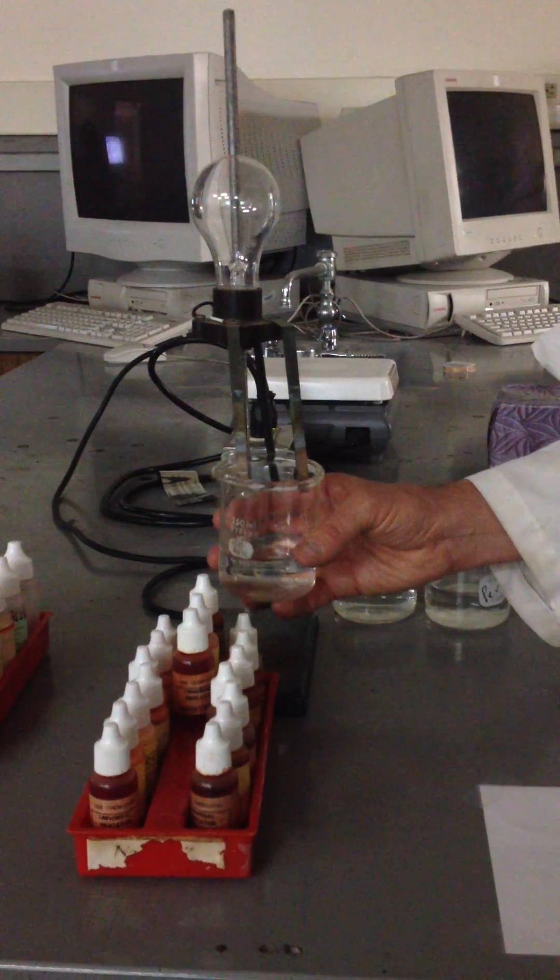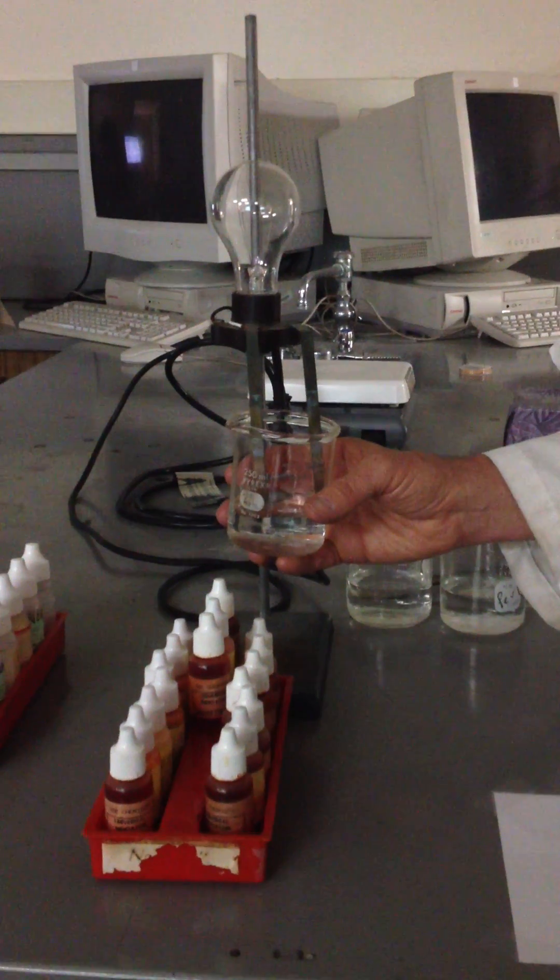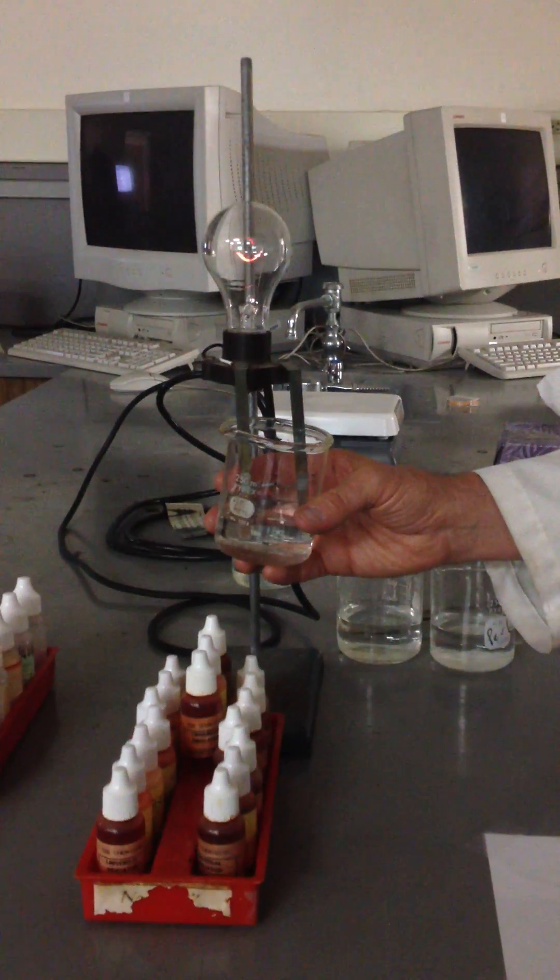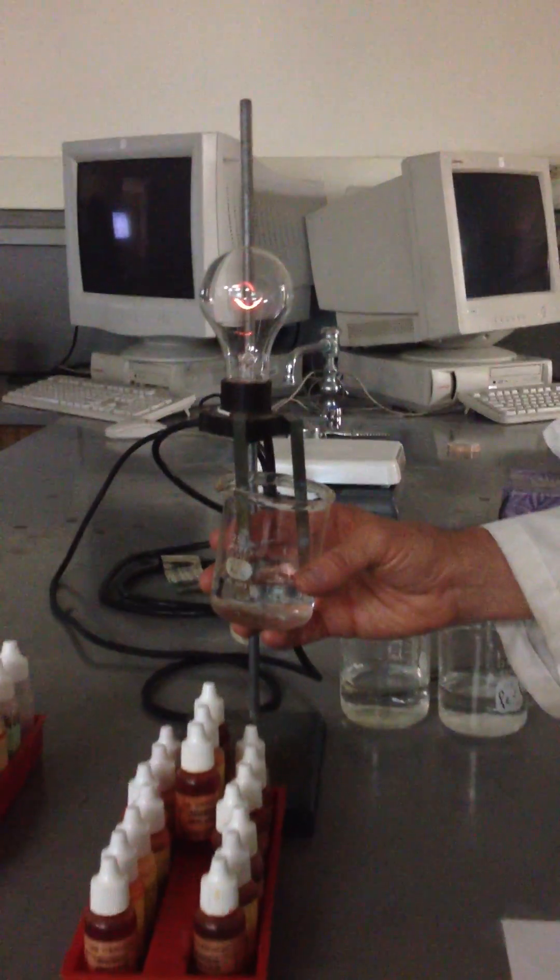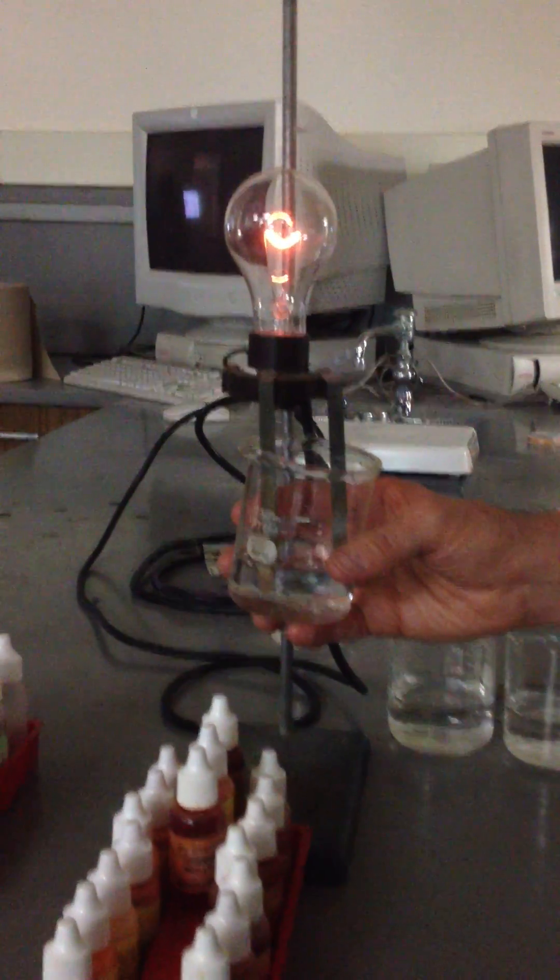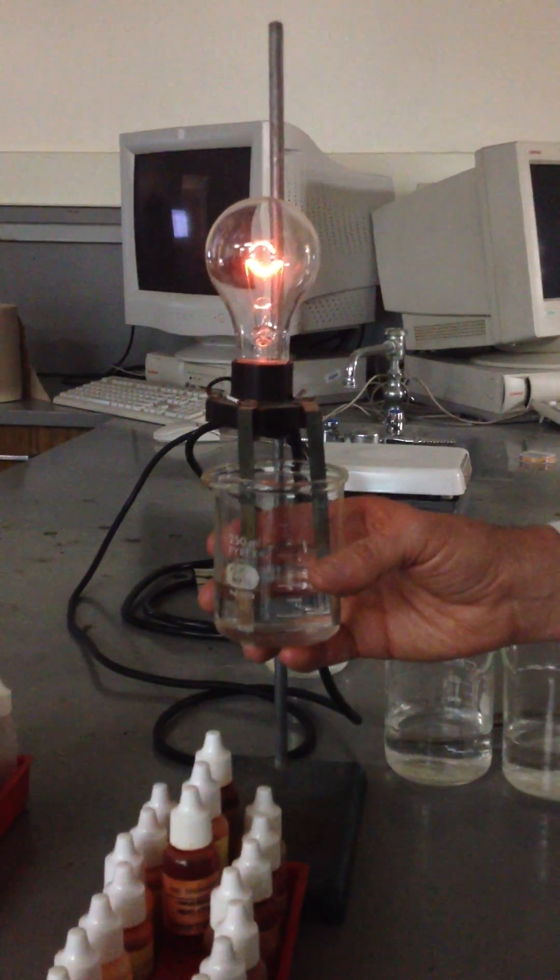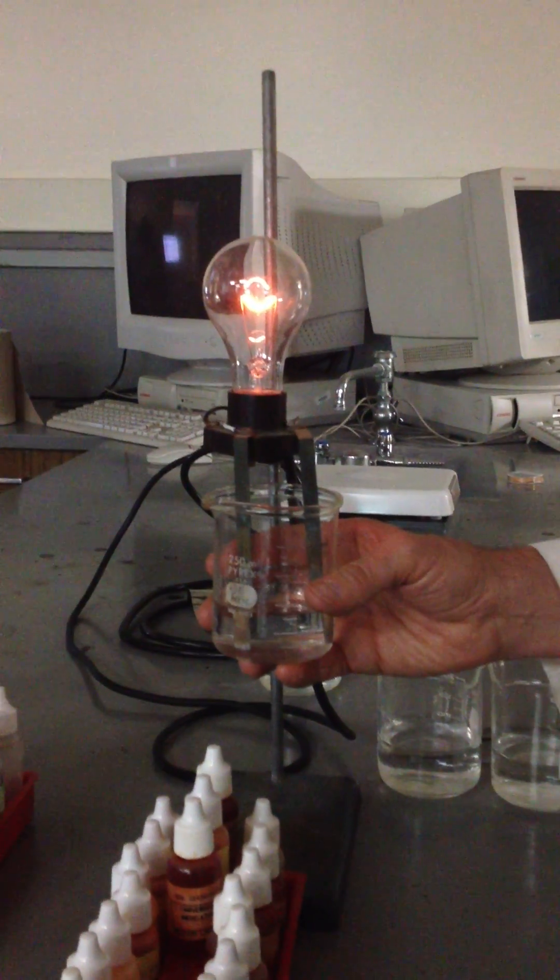Low light. Now you see, it's just barely coming on. And as I get it deeper in the water, you can see that's about as much as I'm going to get.